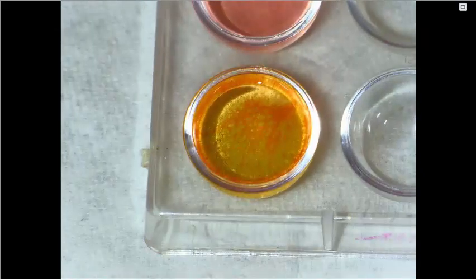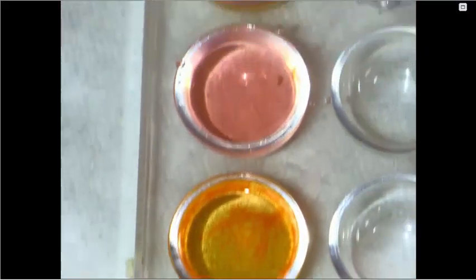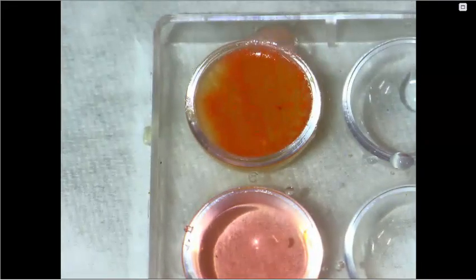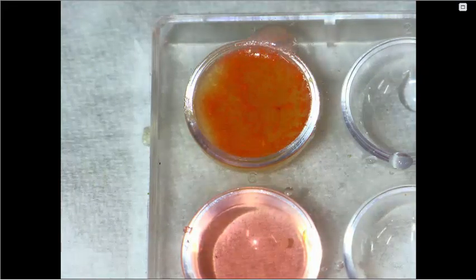So we have our known vegetable oil, we know that there's lipids, and we see a little clumping. We know that water does not contain lipids, so there's no clumping. And in our McMush test, we can see that there are some little clumps, and that means that lipids are present.